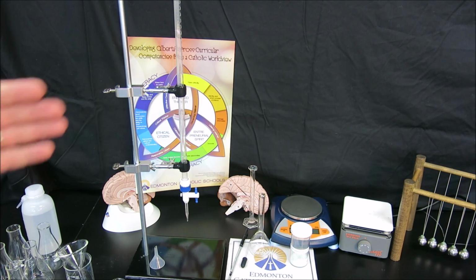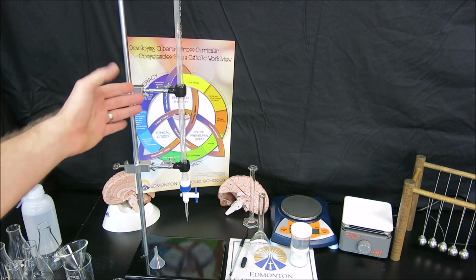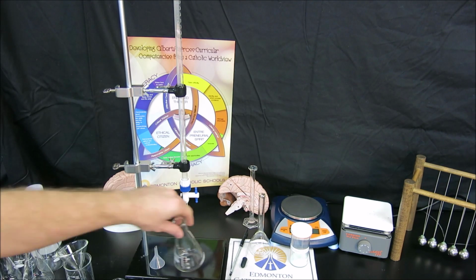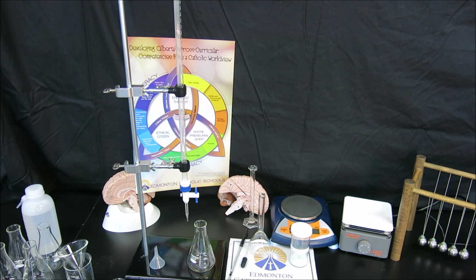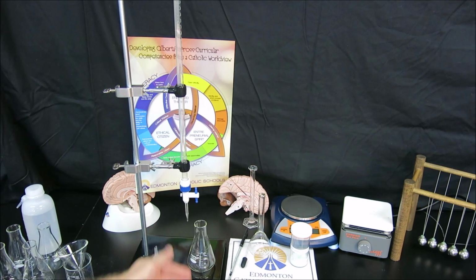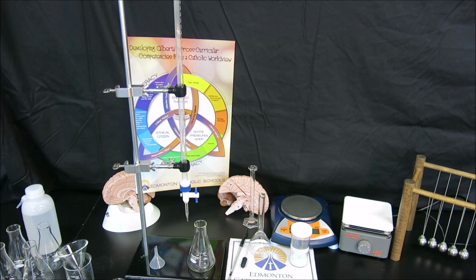In the standardization step, the titrant is going to be in the burette, but the titrant is going to be considered our unknown. The primary standard is going to be in the flask, and our primary standard is going to be known, as it will be calculated and then created from the mass. Once that's done, the titrant again will stay in the burette, but this time the peroxide will end up being where the sample is, and we will use the volume of titrant added to calculate the concentration of the peroxide.